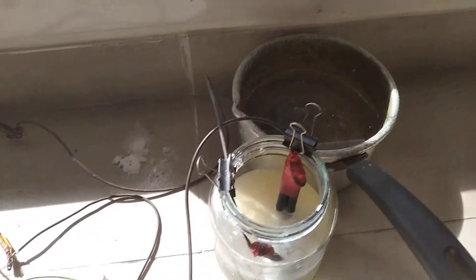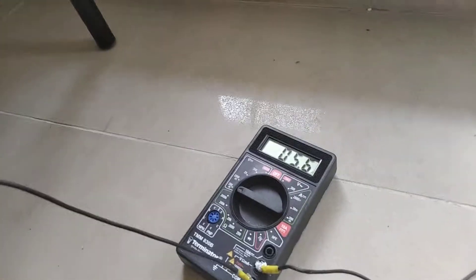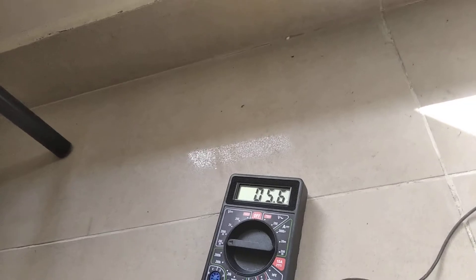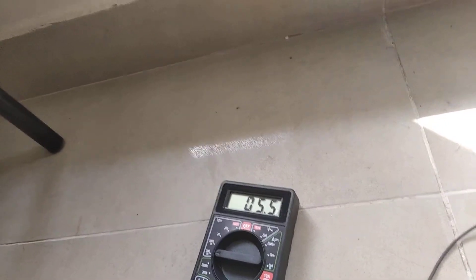So this is actually just a test. Now I'm running this below 40 milliamps per centimeter squared. I use this shunt that has been pre-calibrated before the run using a steel wire and measuring the current with another multimeter.